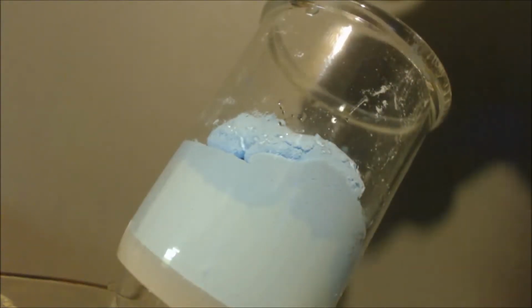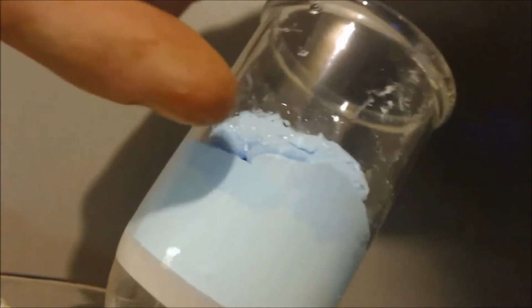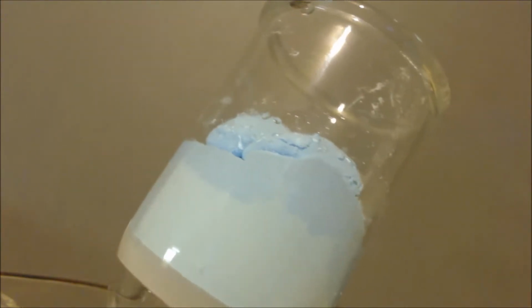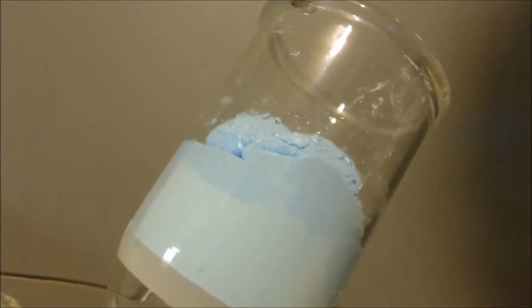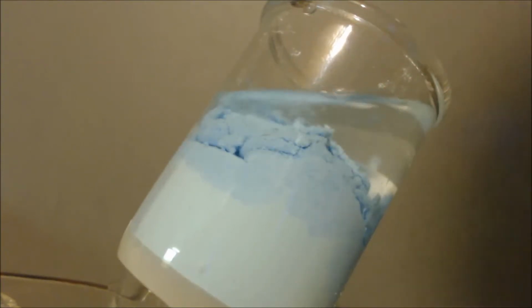I just want to show you something. I poured a little bit of water on top there, and you can see that it can turn more blue, meaning that it could have absorbed more water if there was more in there. Watch, I'm going to put some more in there. Watch as it goes through there. See how it's turning more and more blue? That's because it still has the ability to absorb more water. That proves there was no water in there to absorb, or it would have.